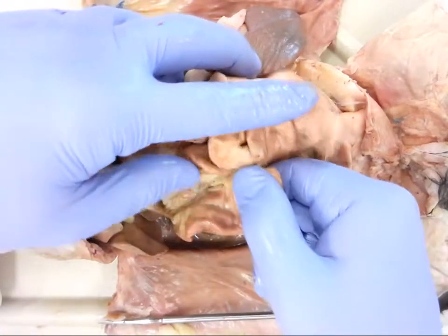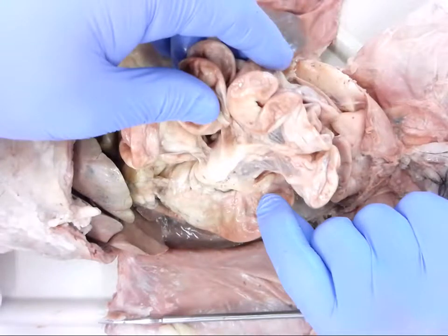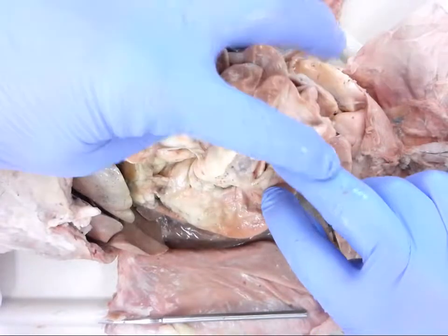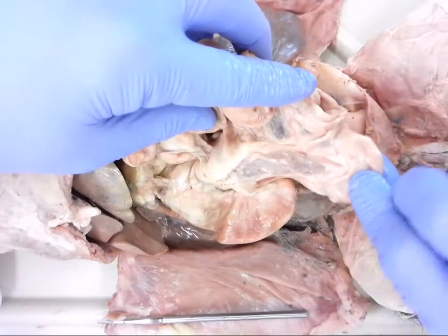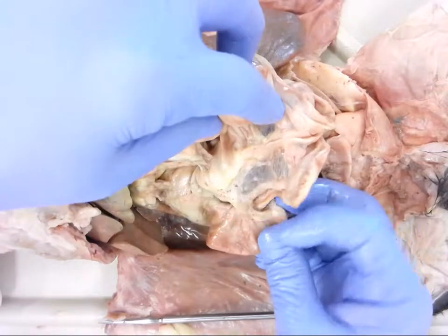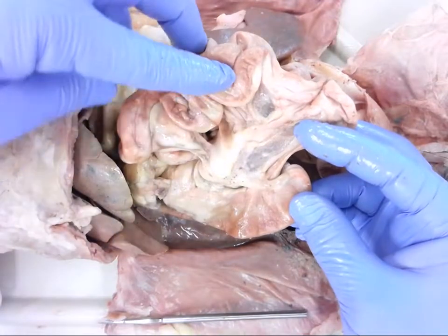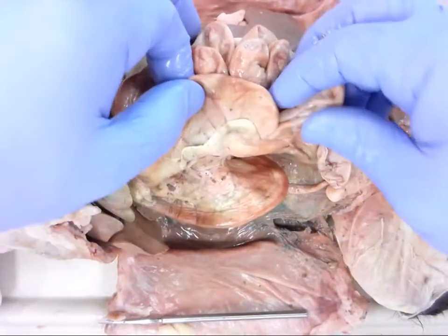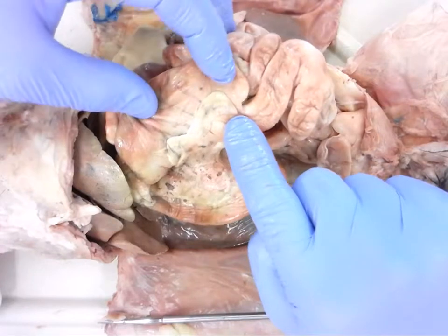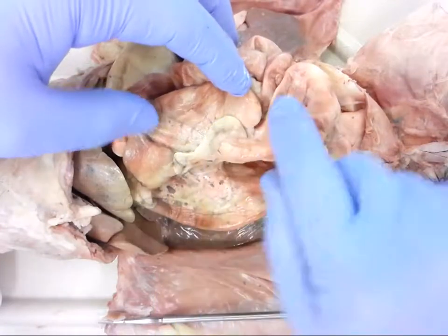To find the ileum, locate the large intestine, which sits right on top of the duodenum — you can tell it's the large intestine because it is just that, large. You can see where the smaller portion of the small intestine enters into the large intestine. On this specimen it's a little easier to see from the back side — flipping it over, you can see right here the ileum going into the ascending colon, which is part of the large intestine.